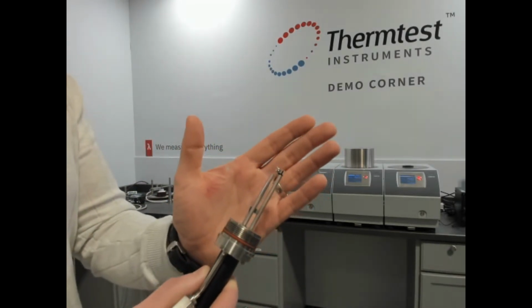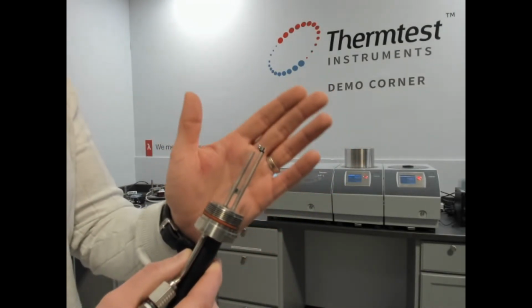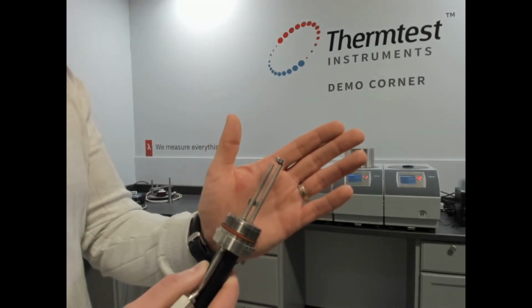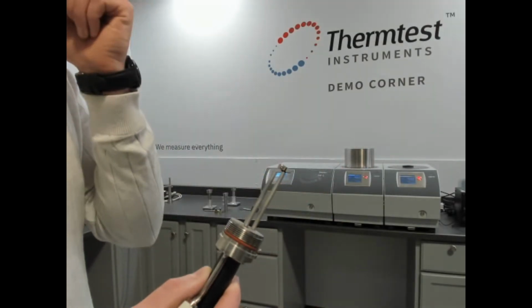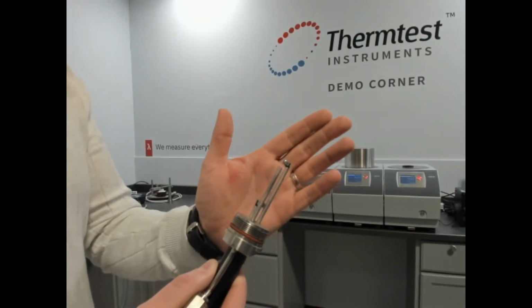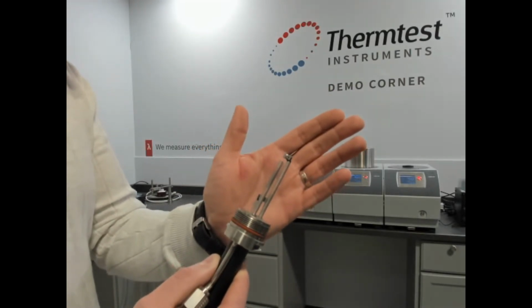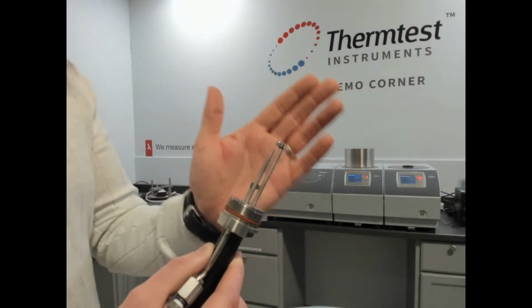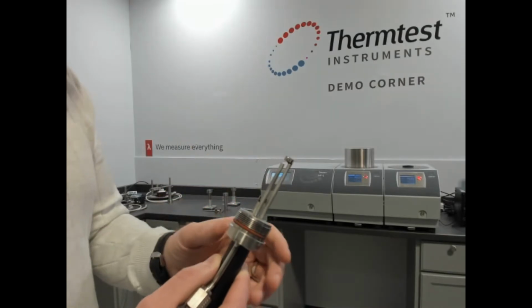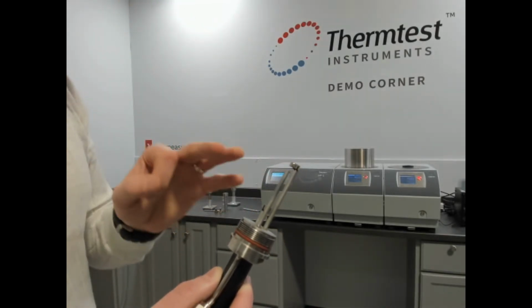So that sensor, it is uniquely designed to control convection. This sensor with the ability to back pressure allows you to test a wide range of viscosity. Convection is the enemy when you're trying to measure thermal conductivity with methods that are designed for solids. This is a primary method designed for measurement of thermal conductivity, diffusivity, and specific heat of fluids. This does follow the standard ASTM D7896 for those 3 properties.